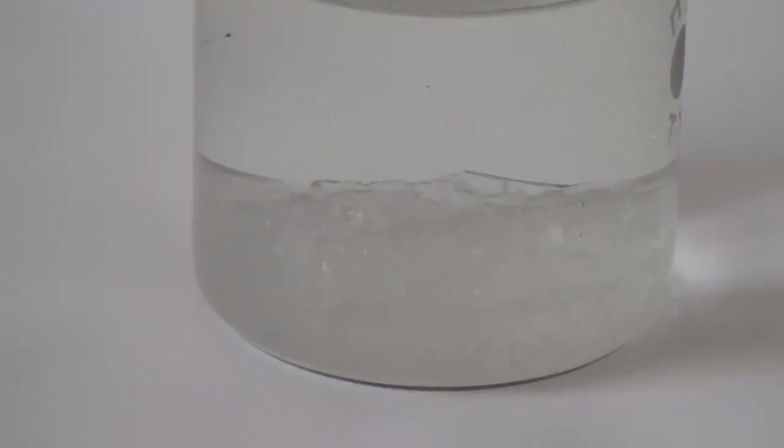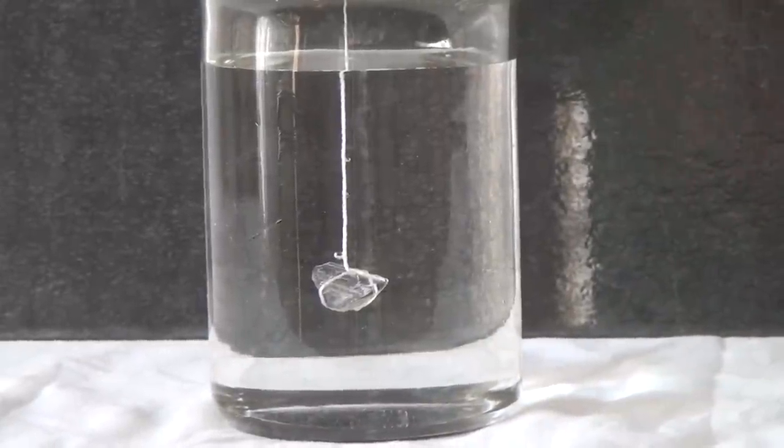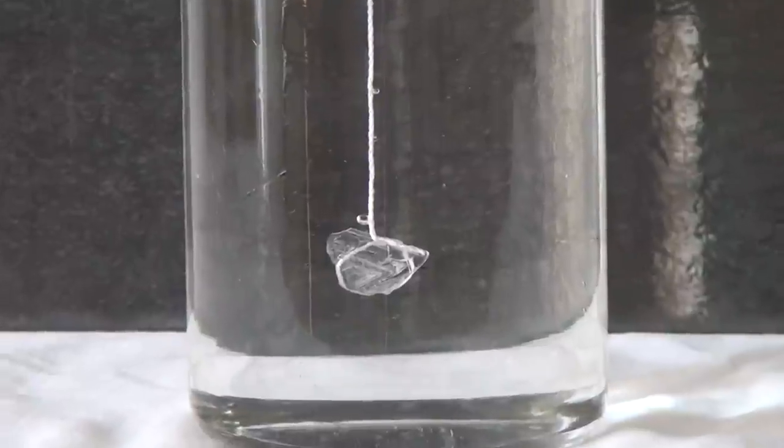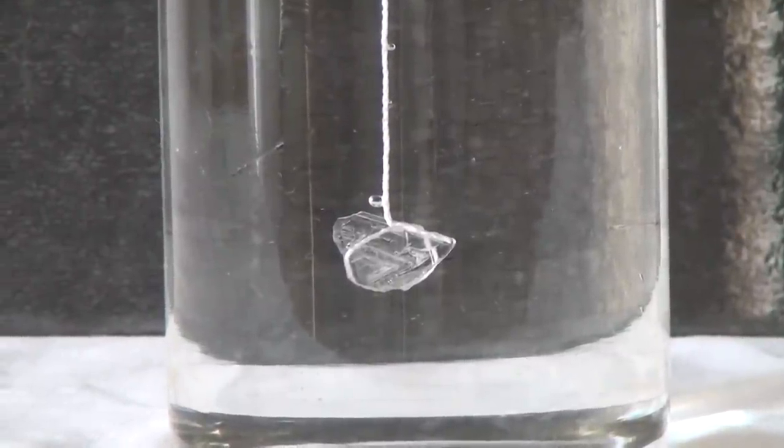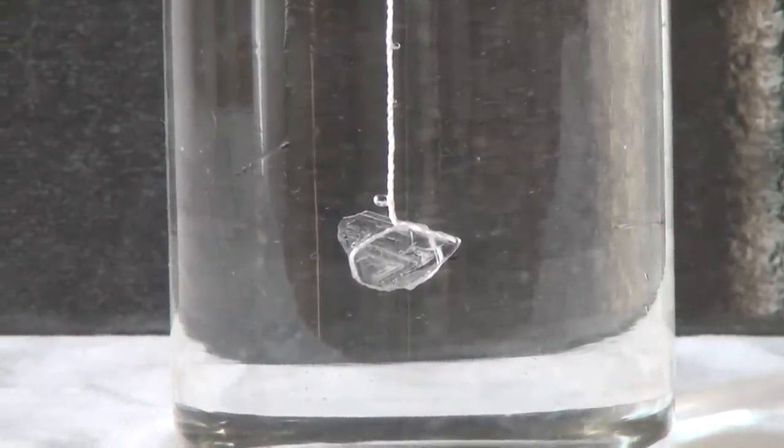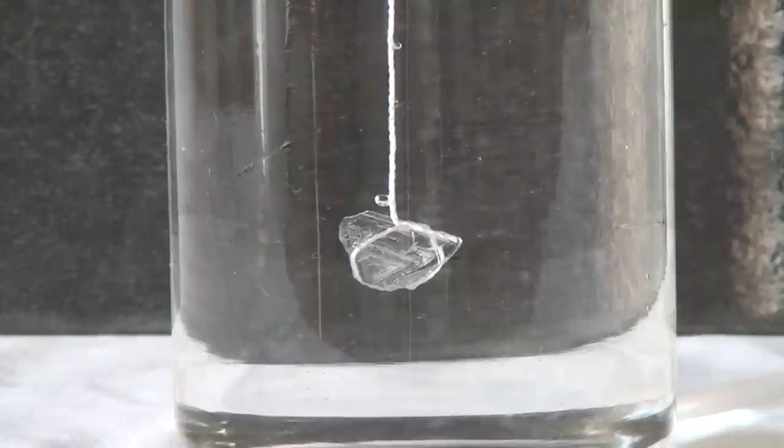After a day, we may notice that beautiful crystals were formed at the bottom of the beaker. These crystals will be used as seeds. A seed is a small crystal that is immersed into the solution, which will continue to grow new layers of a crystal on top of it.